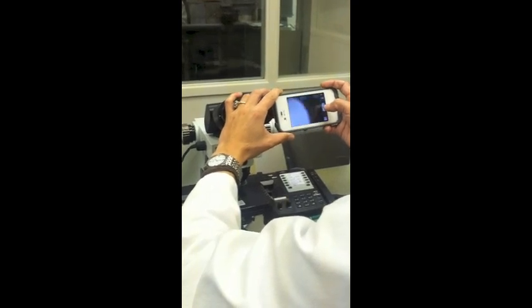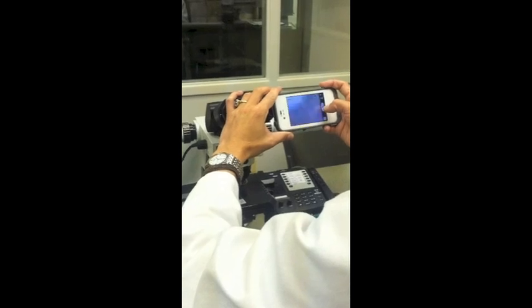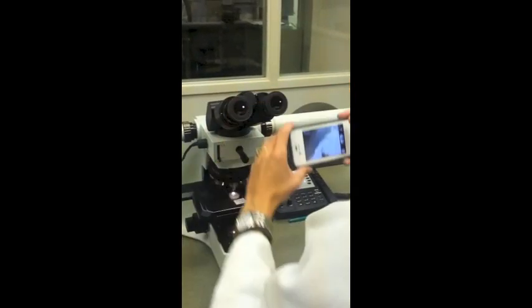Don't get frustrated if at first you have a hard time getting the image to come into focus and stay in the light. The key is stability, and the more you practice, the easier this technique will become.